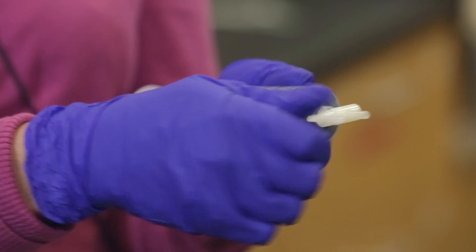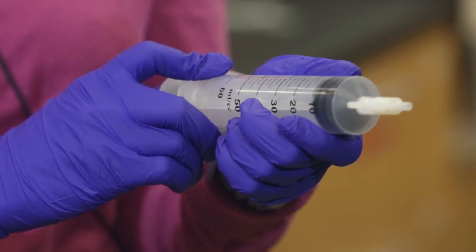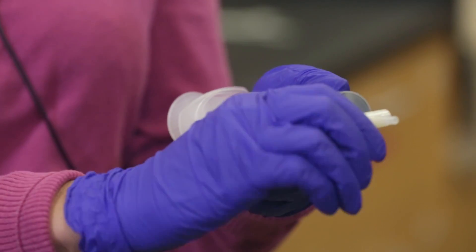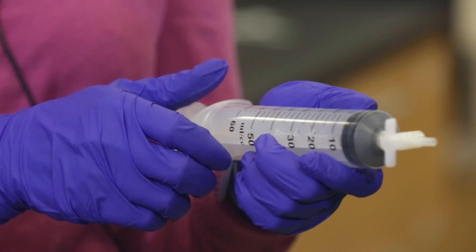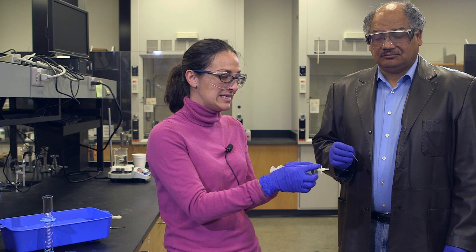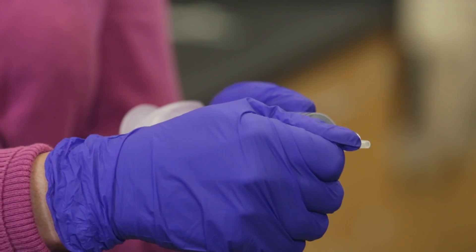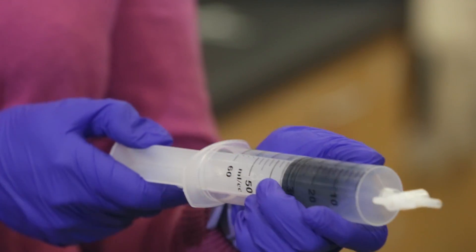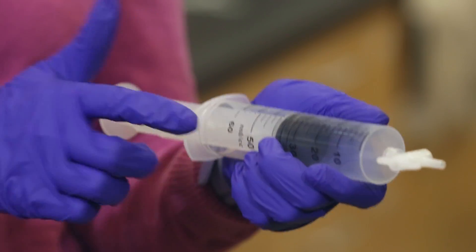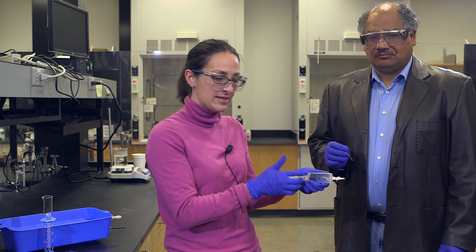This is closed and this is open. You can tell — if you forget which one is which, just test it out. So in order to have the empty syringe mass, I need to have this closed and then I'll pull back. Just think about: if I have it open and I put the nail in the nail stop, is it really empty? What's occupying that space?